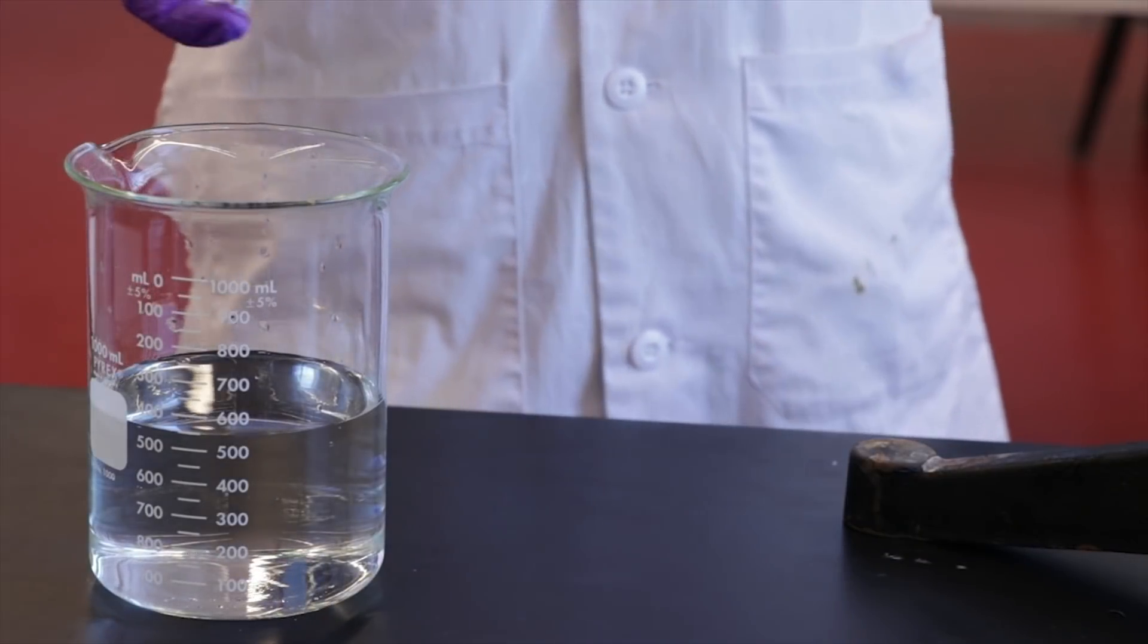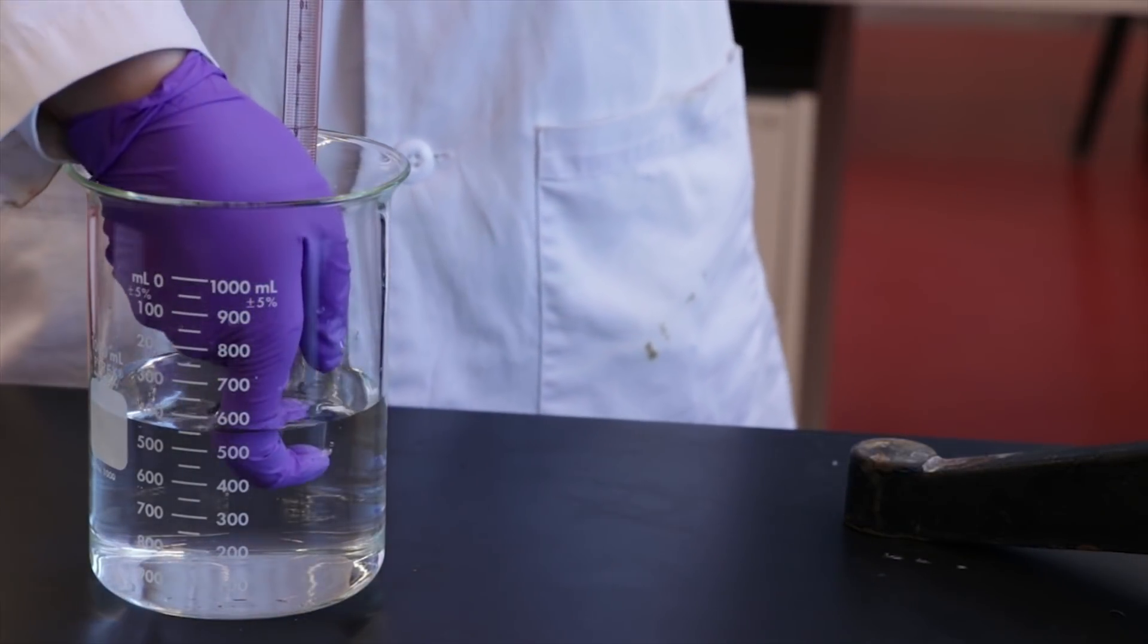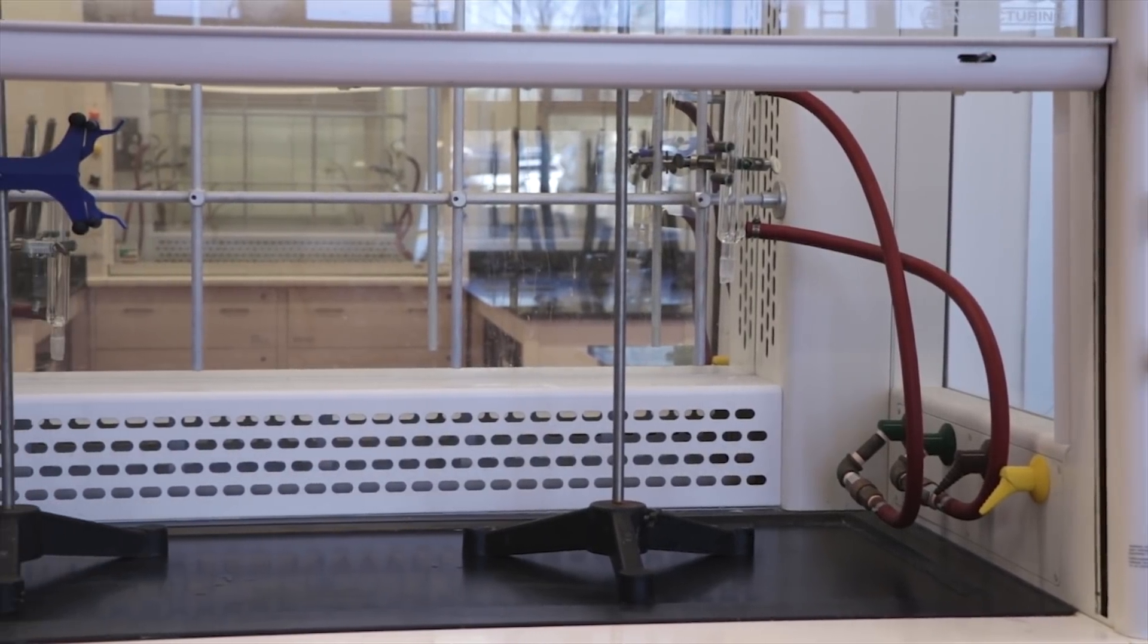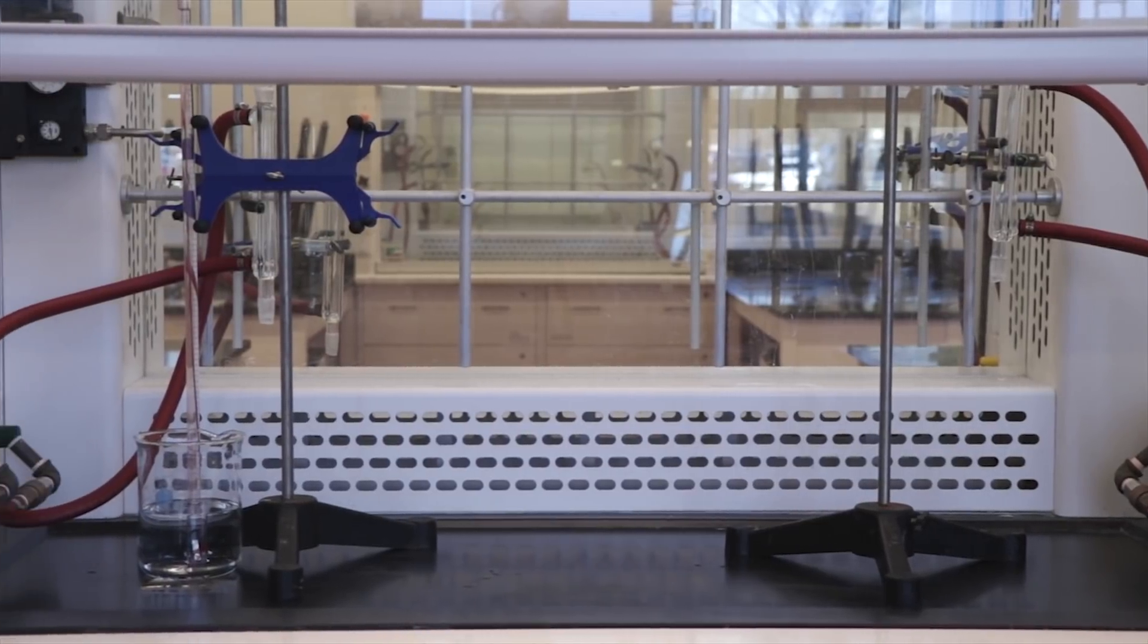Begin by practicing inverting a burette full of distilled water into a beaker. Note that this experiment should be done inside the fume hood. In this video it is done outside the fume hood for demonstration purposes only.